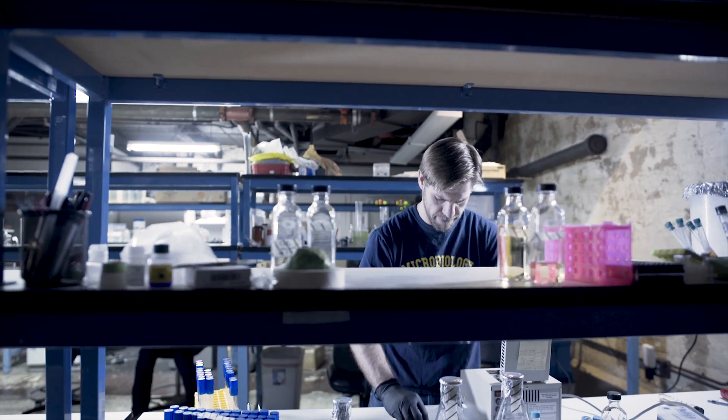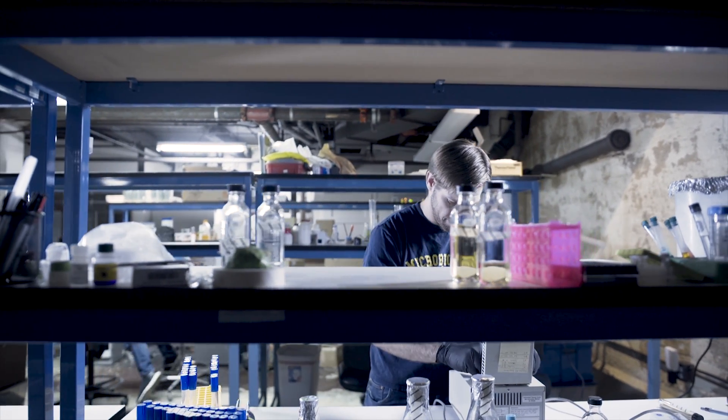Hi, this is Zach. I'm a PhD microbiologist at ZBiotics, and today we're going to do some genetic engineering.